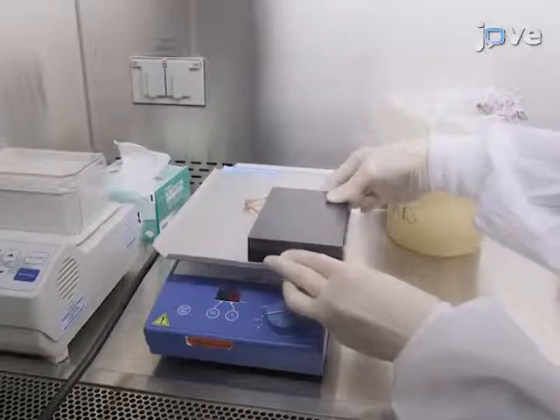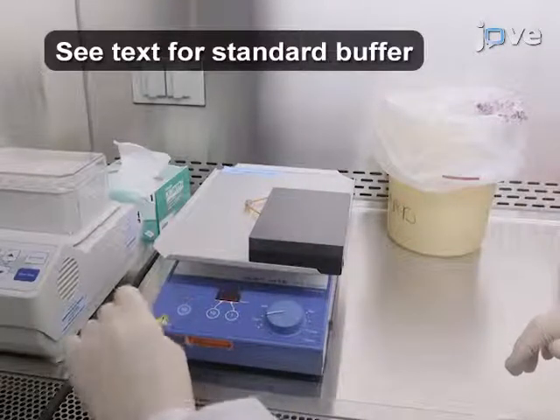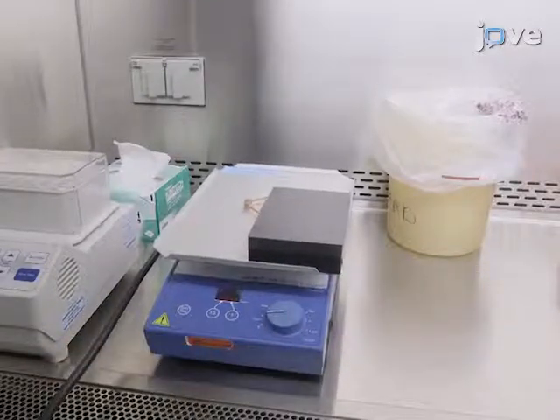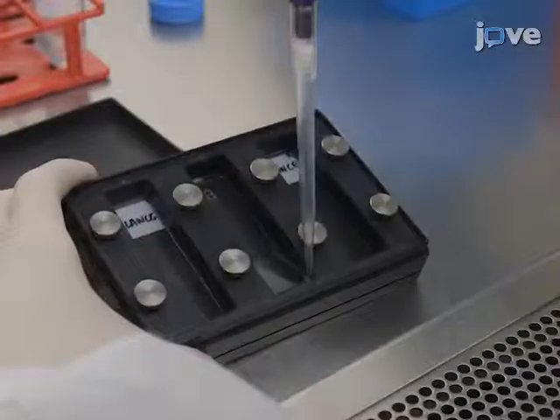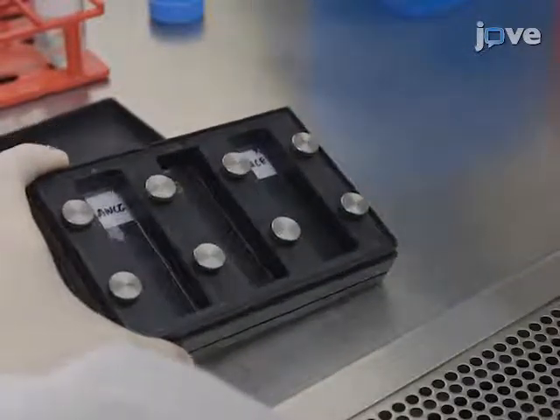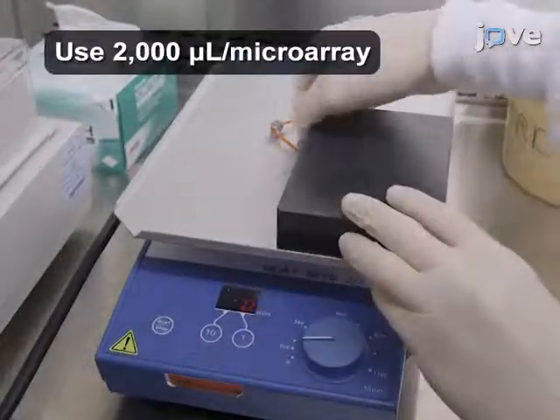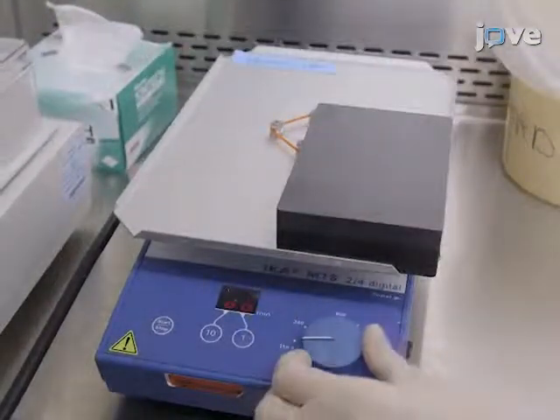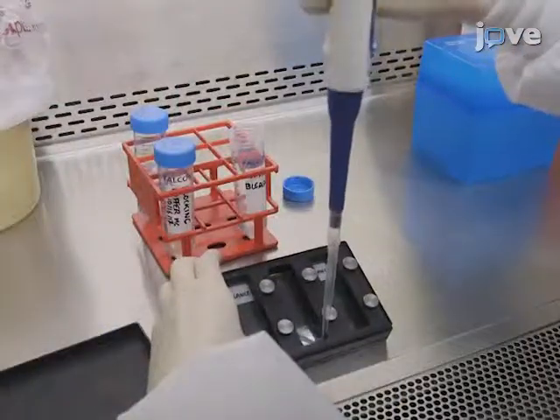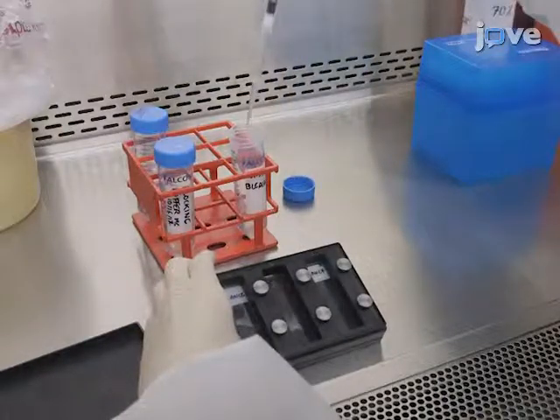Incubate the microarray with 2,000 microliters of standard buffer per microarray for 15 minutes at room temperature on an orbital shaker at 140 rpm. Remove the standard buffer by aspirating with a pipette from the corner of the microarray chamber. Then block the microarray with the blocking buffer for 60 minutes at room temperature on an orbital shaker at 140 rpm. Remove the blocking buffer by aspirating from the corner of the microarray chamber with a pipette.